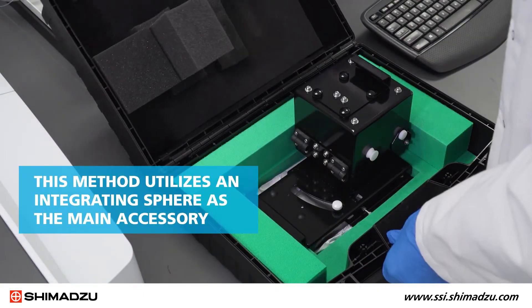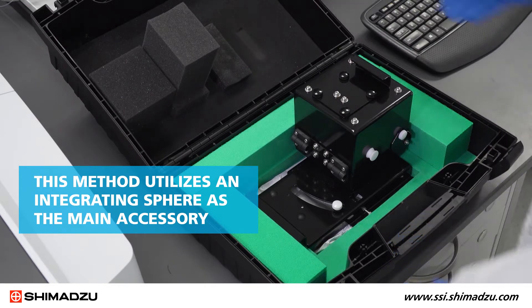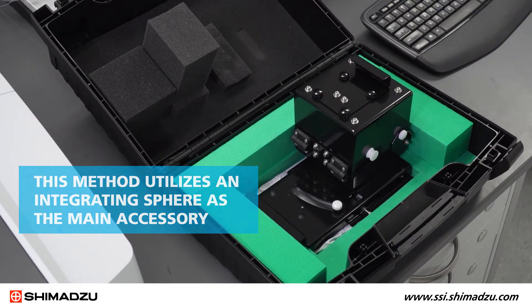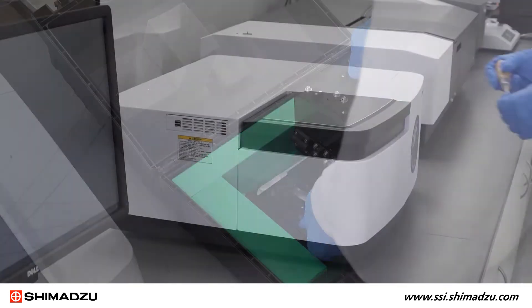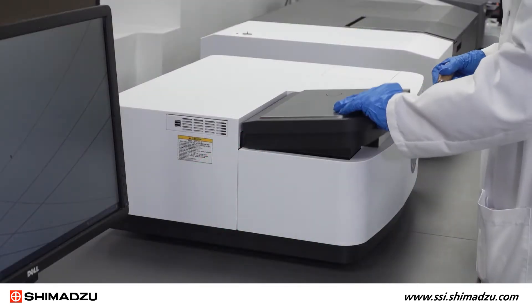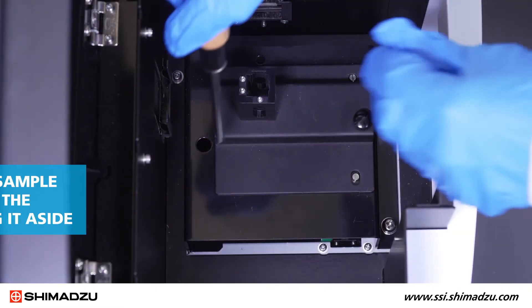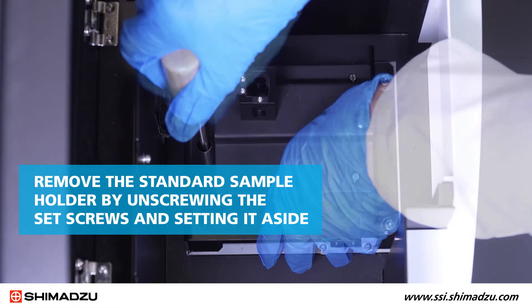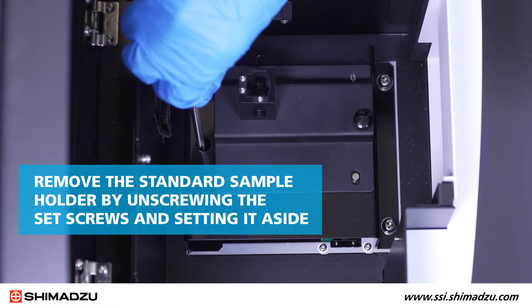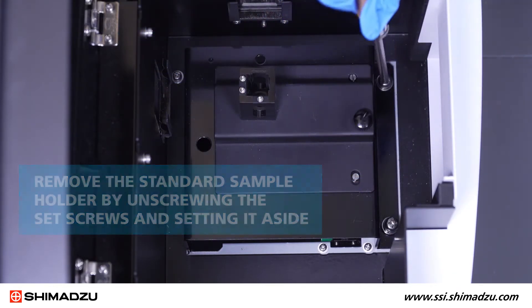This method utilizes an integrating sphere as the main accessory, so first you must install it in the sample compartment of the RF6000. Remove the standard sample holder by unscrewing the set screws and setting it aside.